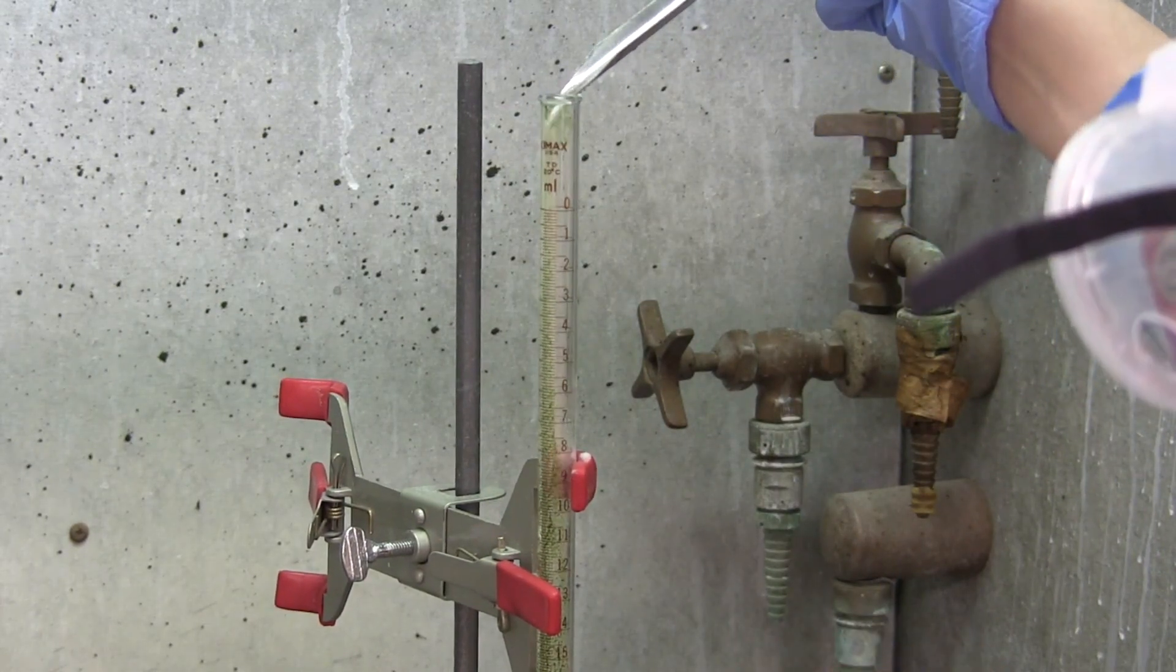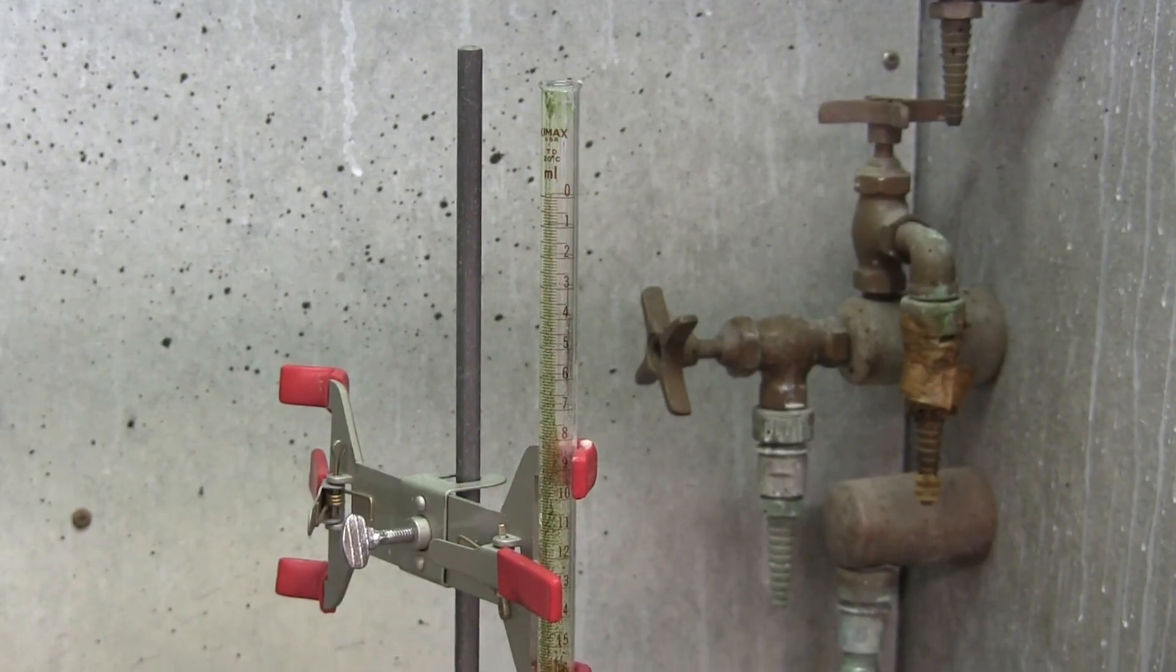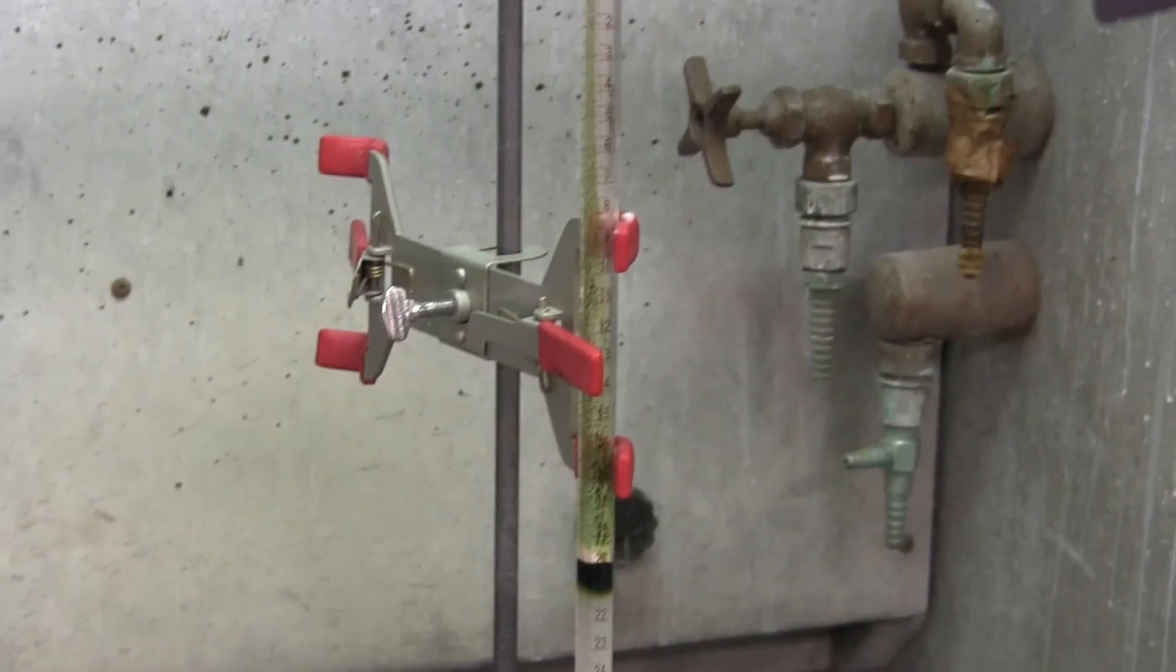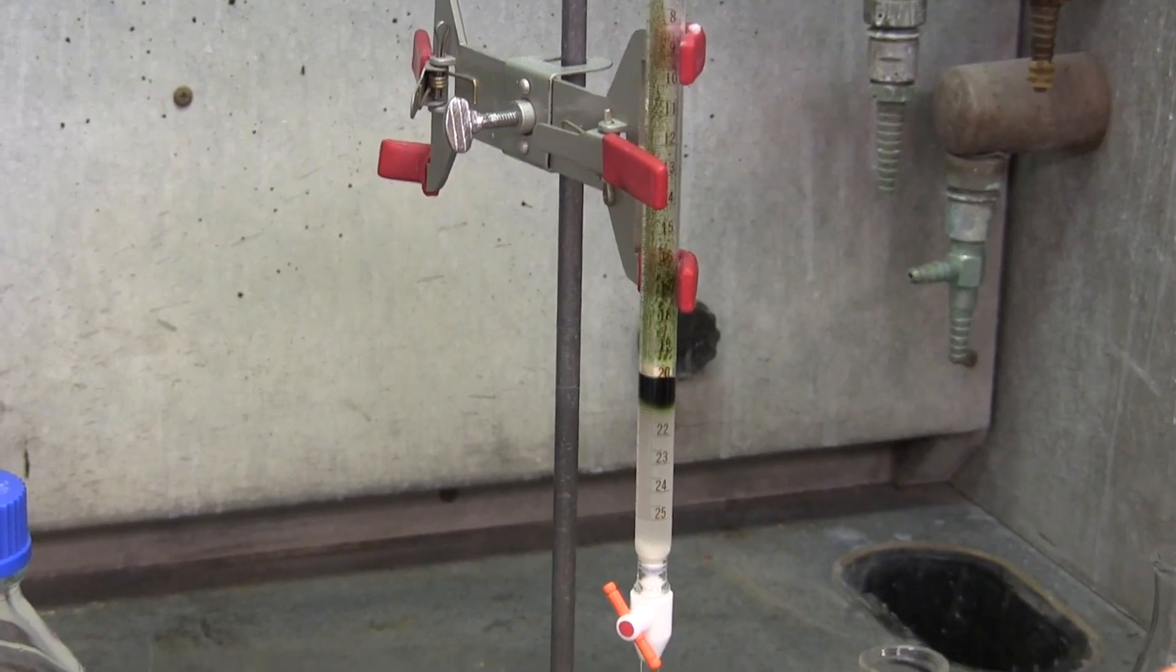A layer of sand, about 0.5 centimeters thick, is added with a spatula. This will protect the column from being disturbed when adding in the solvents to perform the elution.